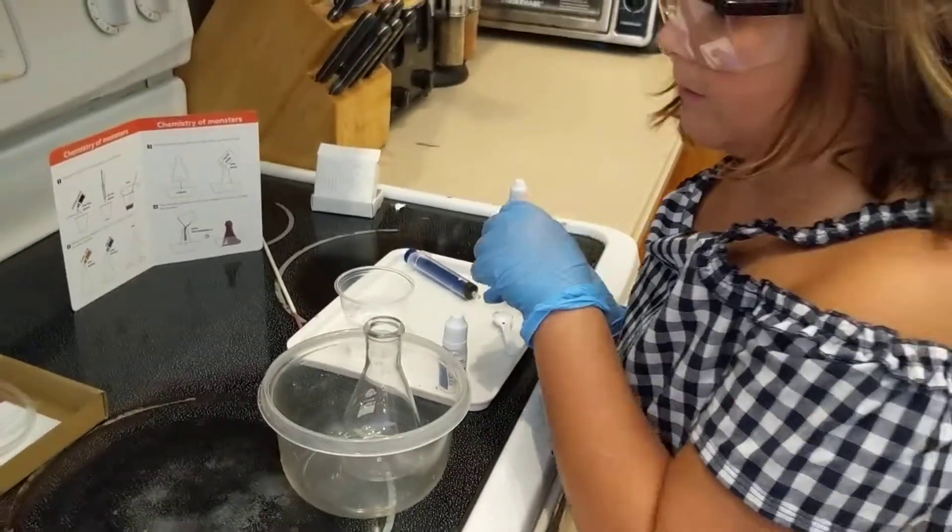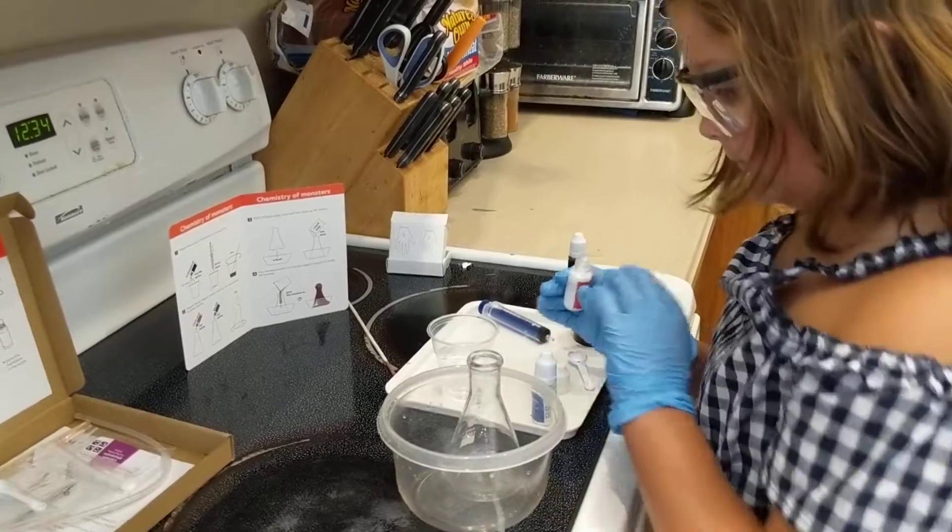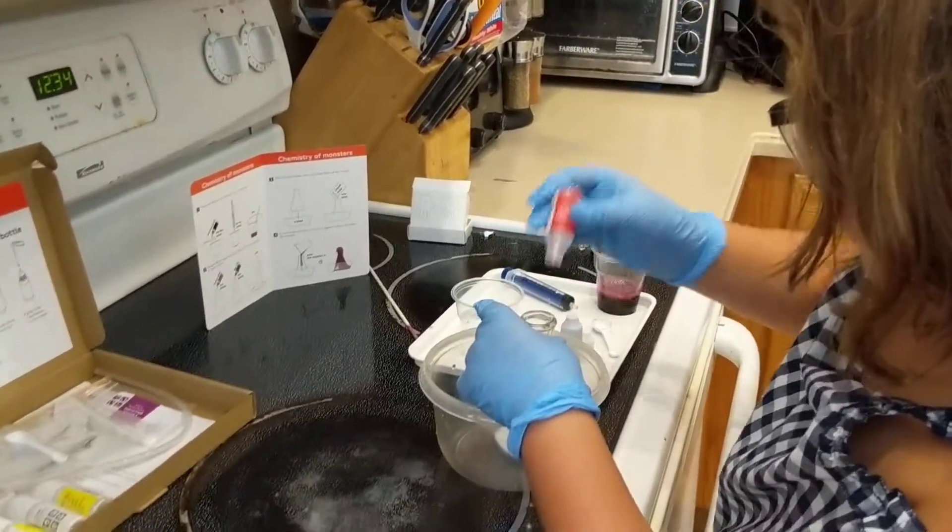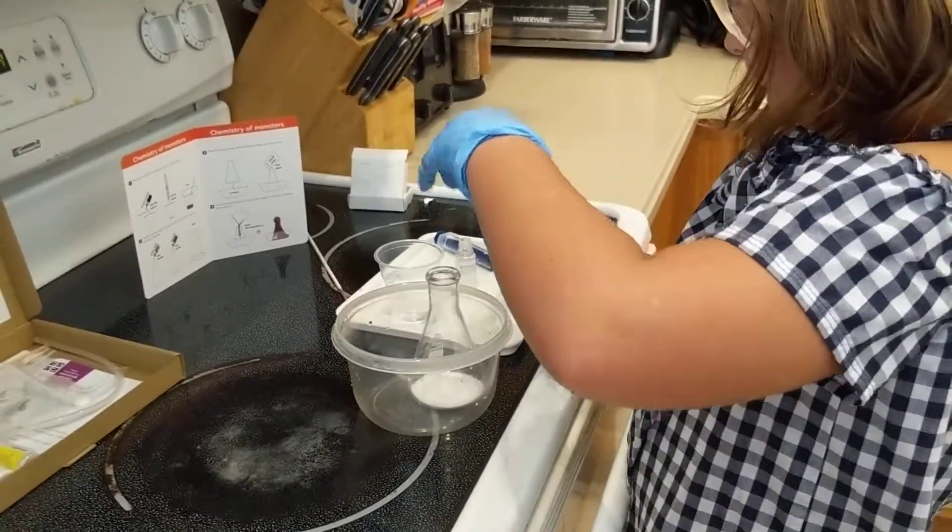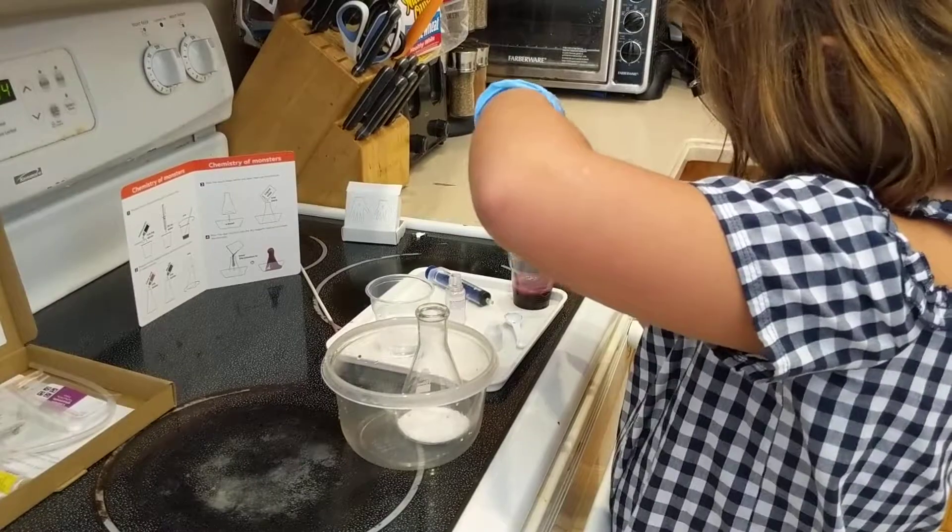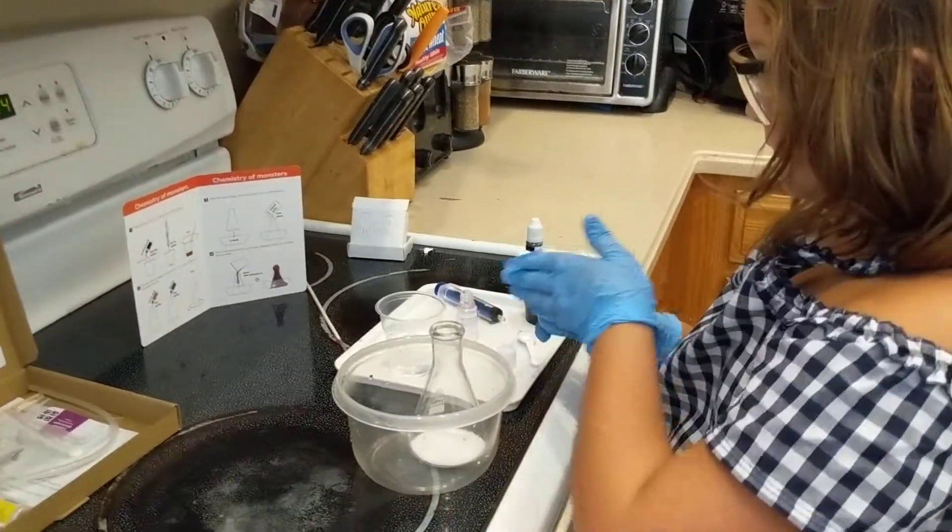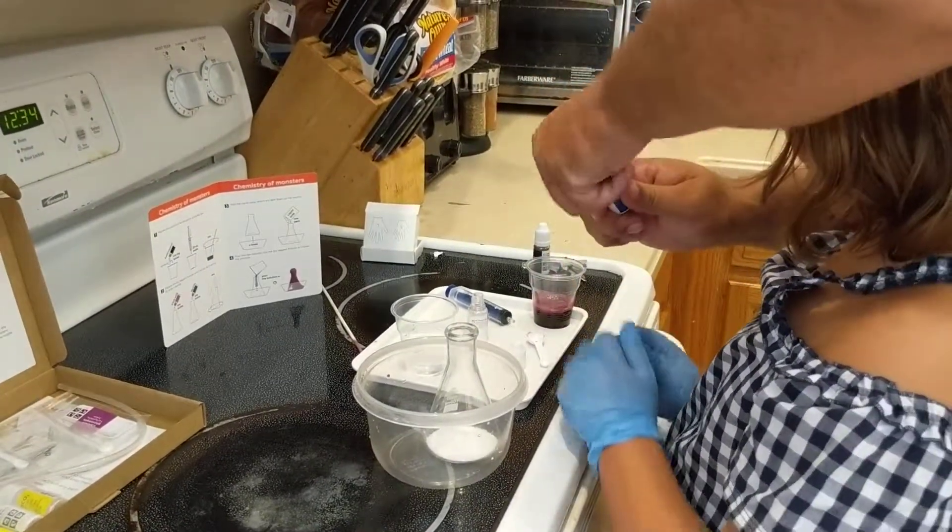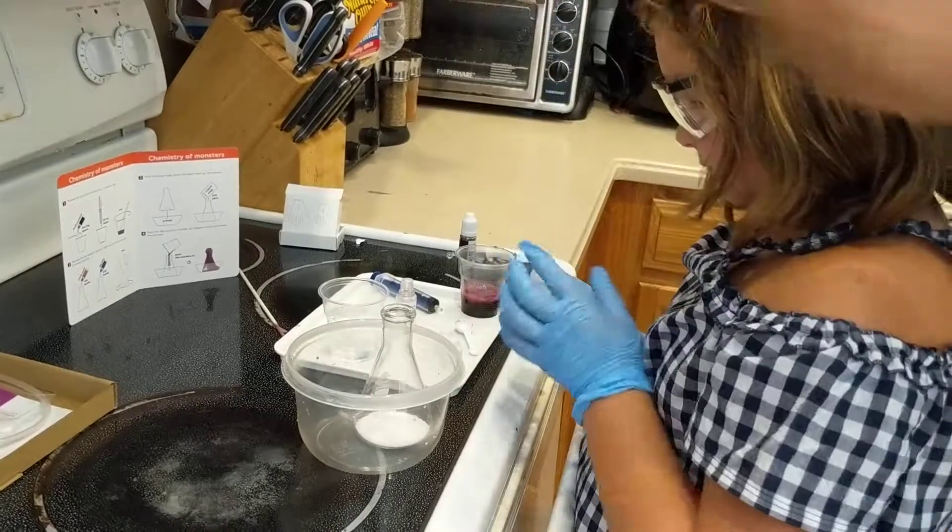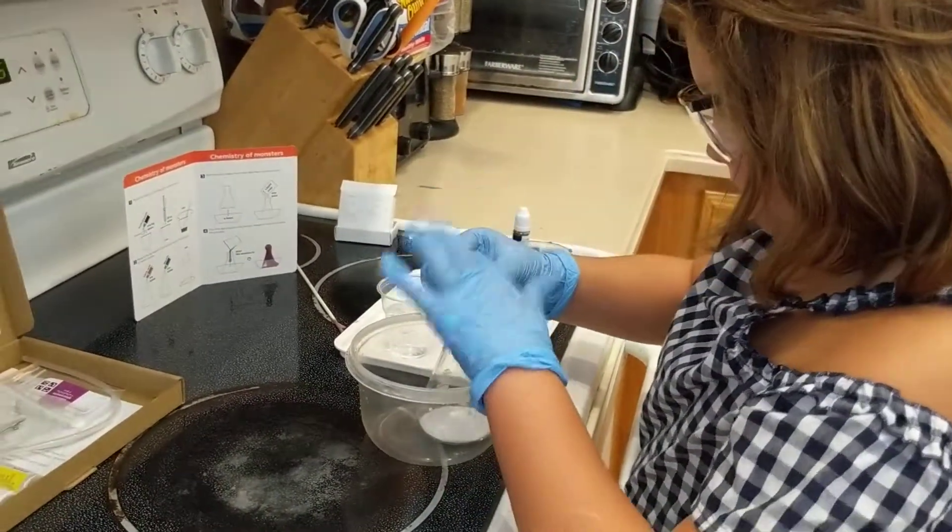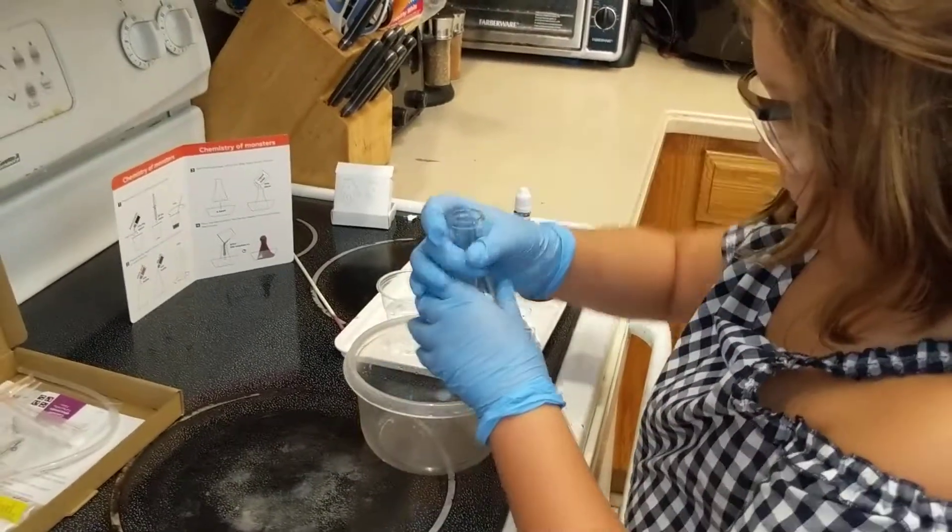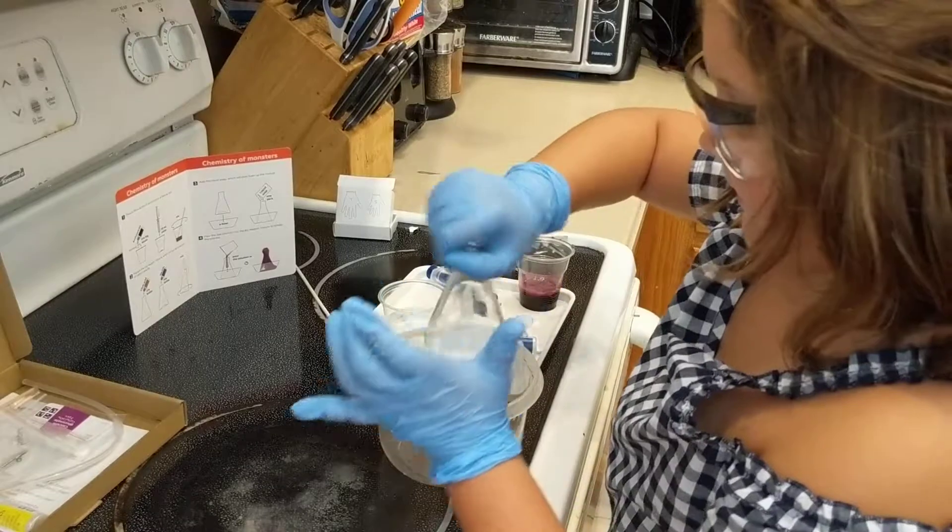Nope, there's a whole other set of them in there. That's all of it. There it goes. Okay, you should be good. And now swirl it around a little bit so it mixes itself. It's a weird noise.